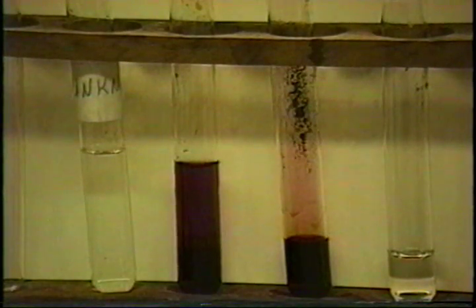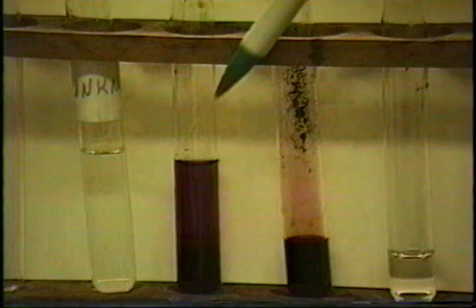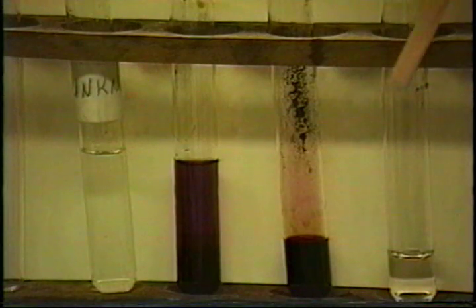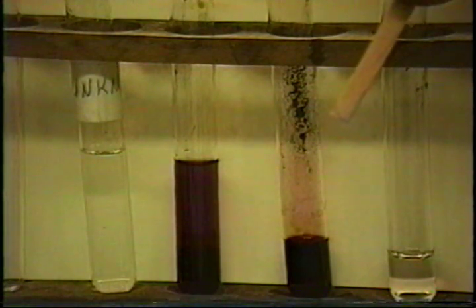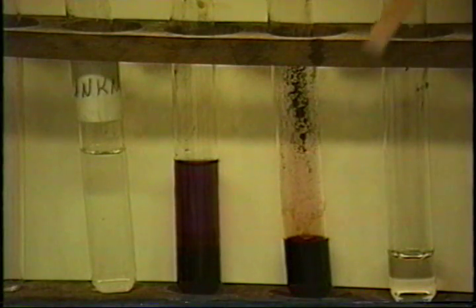All right, here's a close-up of the confirmation test. This is diluted slightly, so the color shows up a little bit better, but this is the purple color in the hexane. You see the hexane layer on top. And I'm also showing the purple vapor we got when we heated this tube. And finally, what I'd like to show is this piece of pink litmus. You see, it's all around the edges where it's touched the sodium hydroxide on the side of the test tube, but the rest of it remained pink, which means that no ammonia vapors were generated, which is the test for ammonia. So that's a negative. This is a negative test.